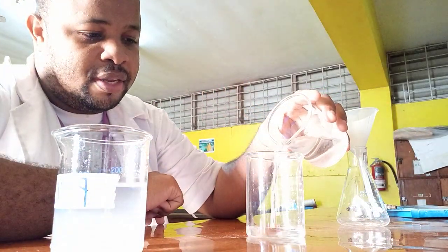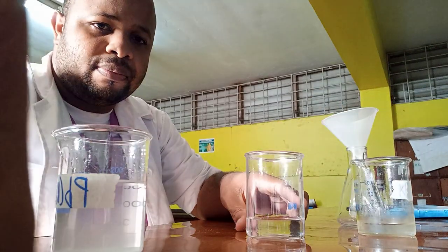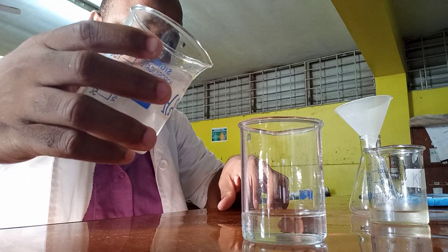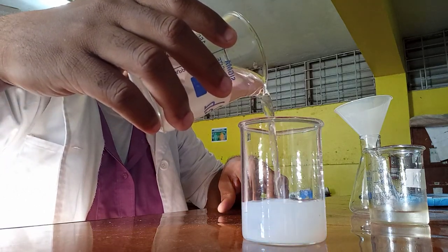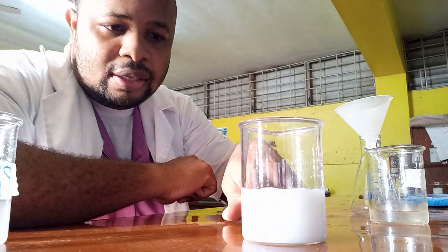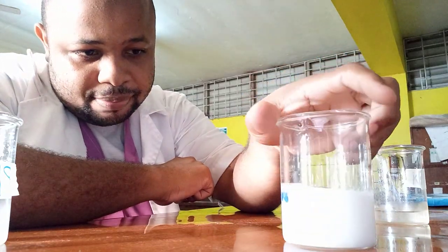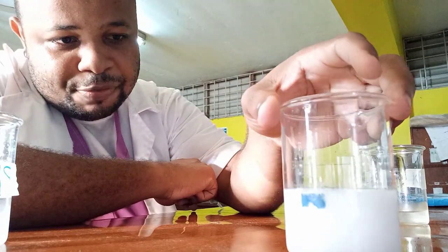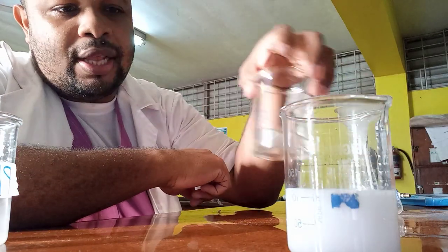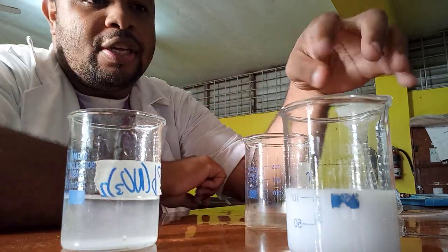So I'll pour out some of the potassium bromide solution and then add some of the lead nitrate solution. As you can see, it got cloudy — and you can see it is forming a white precipitate. So in here we mixed potassium bromide and lead nitrate.